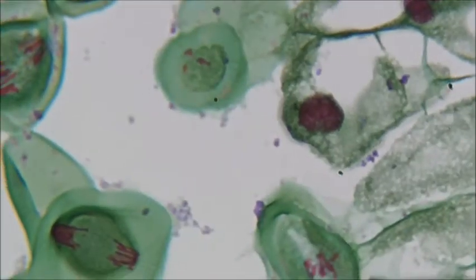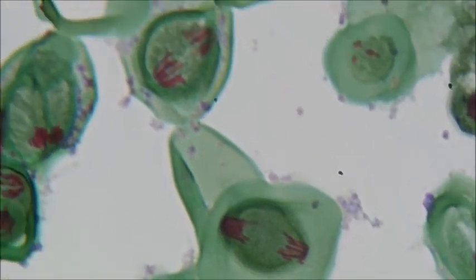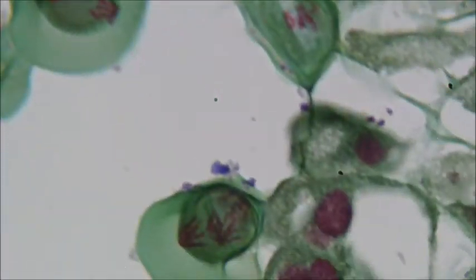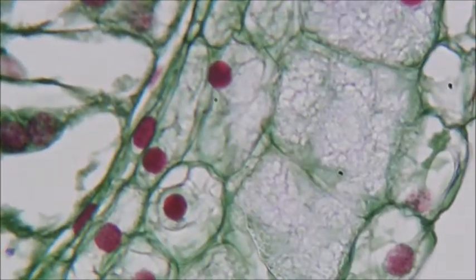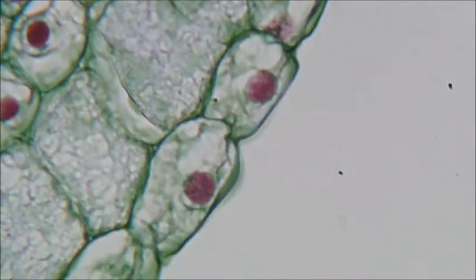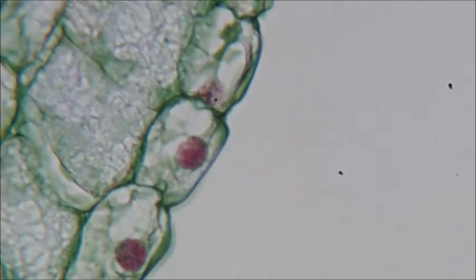I don't know if you've learned about mitosis, but this cell right here is about to split into 2 cells, and you can see the genetic material has split to go to either side, and it's about to pinch in the middle and will turn into 2 cells. So this is the middle, the inside of that stem where all of this cell division is occurring. And then when we go out, you can see more plant cells, all very organized, stacked next to each other. This is the outside of the stem. You can clearly see the nucleus in there.